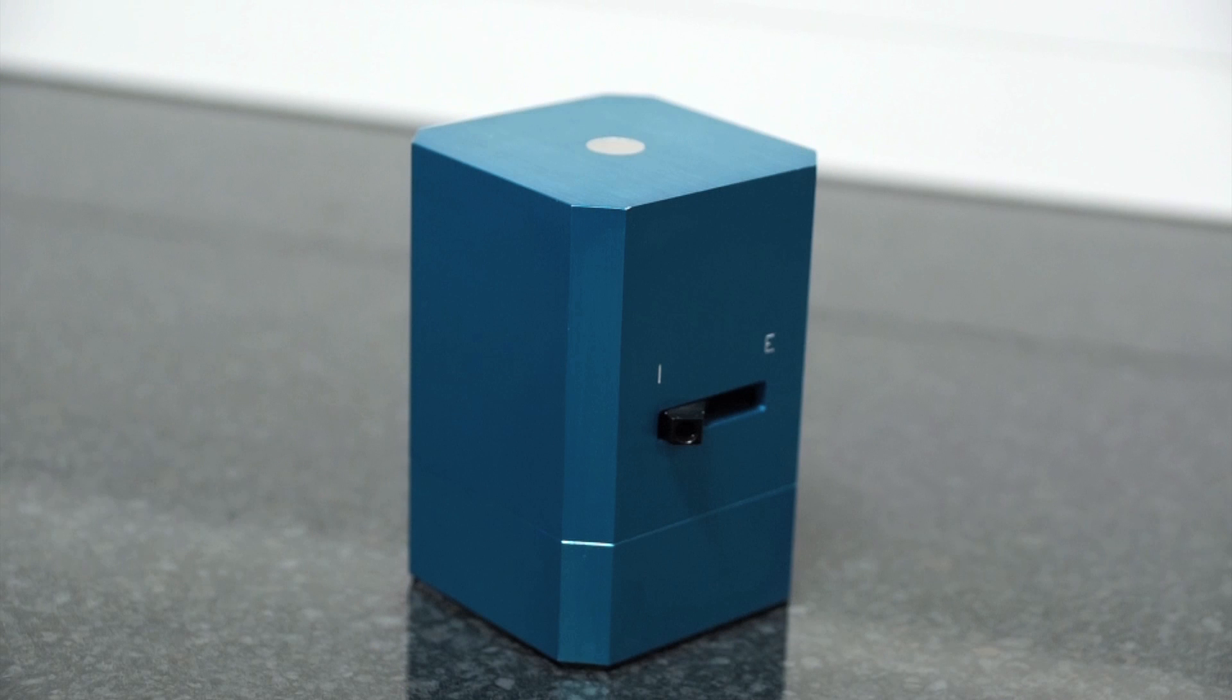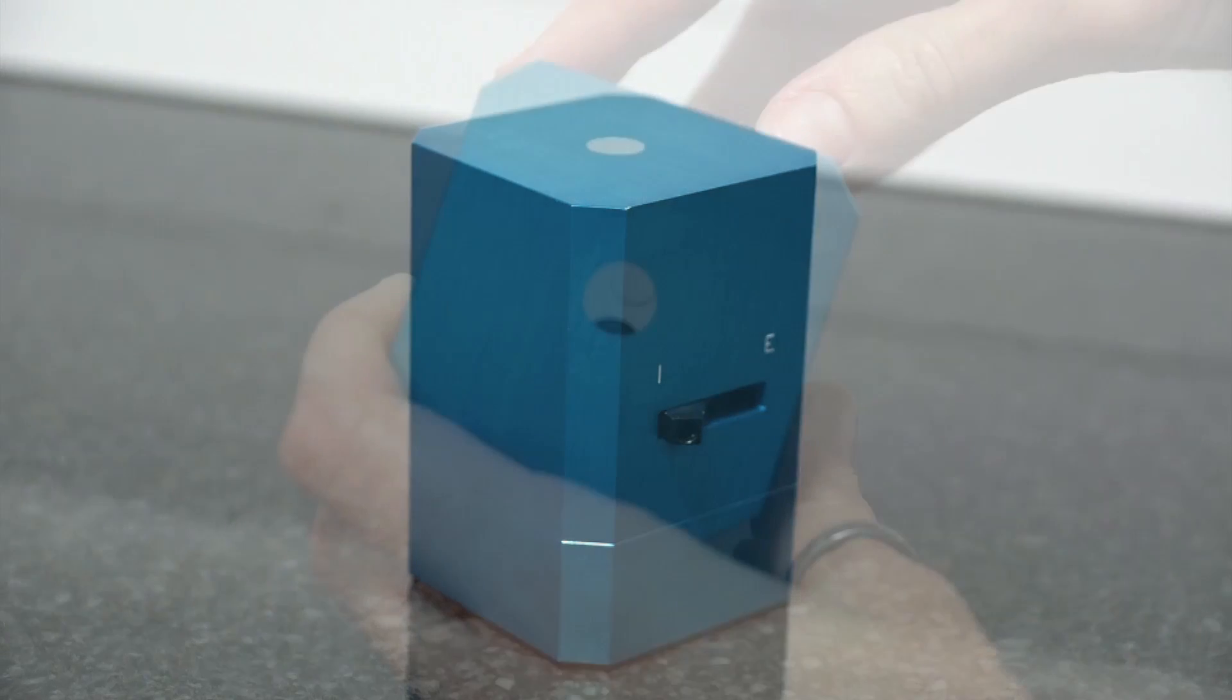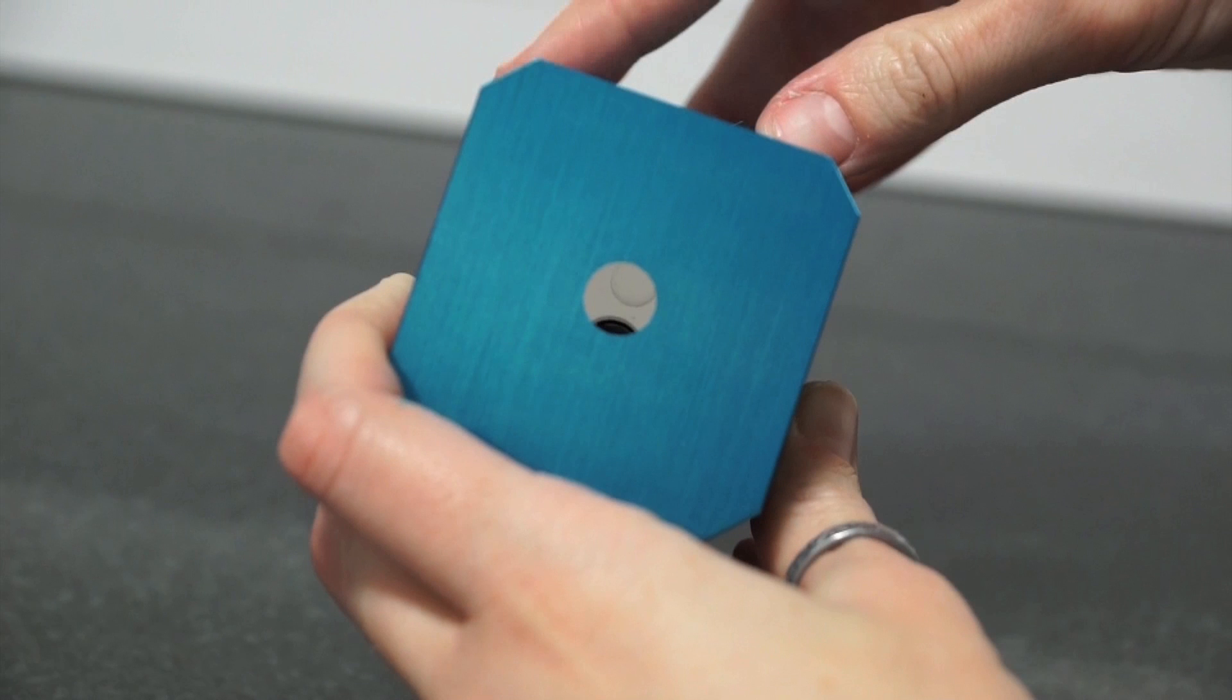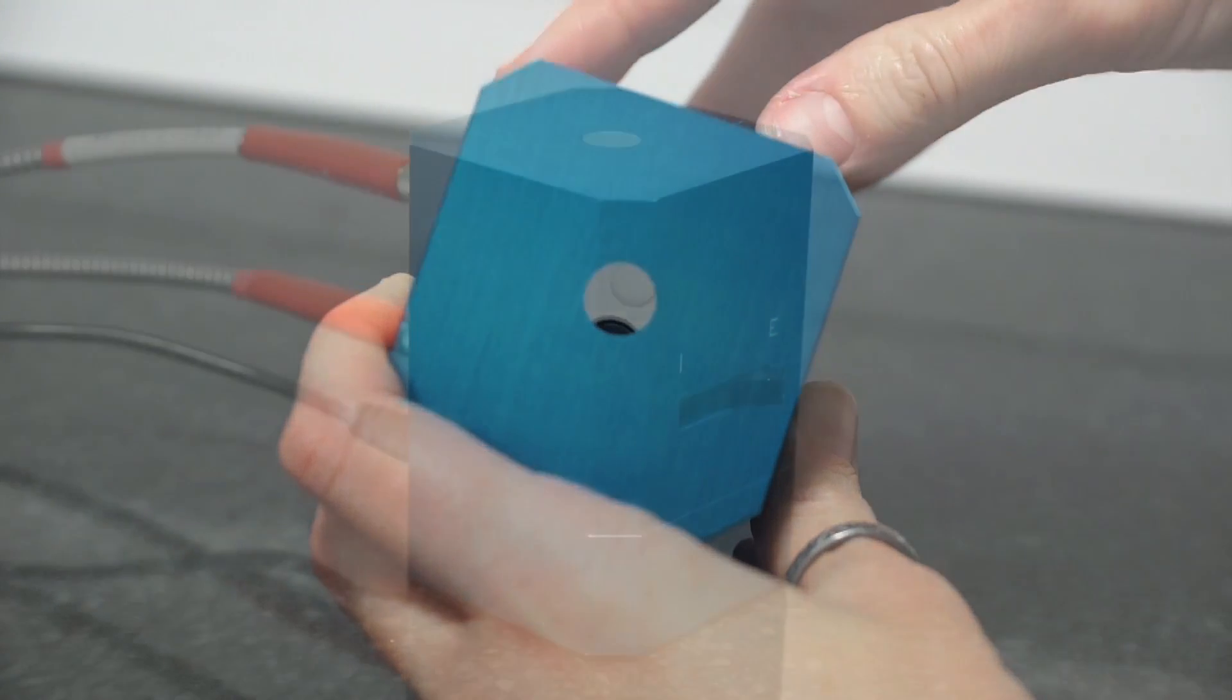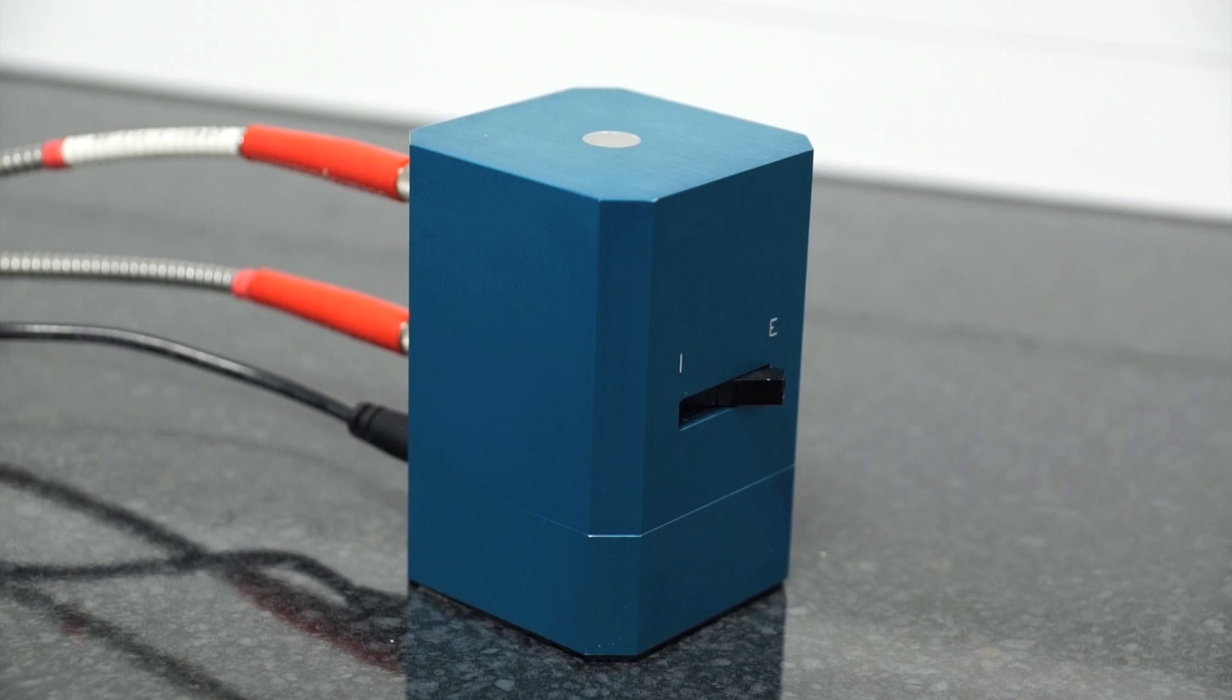When closed, it fills in the gap, and specular reflection is retained and included in your measurement. Make sure the gloss trap is kept in the same position for reference and sample measurements.